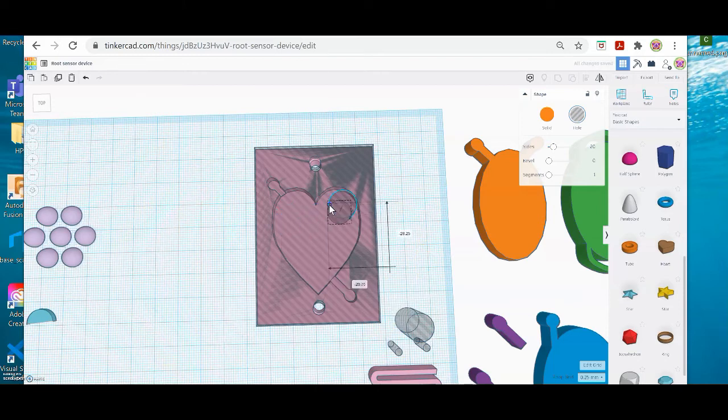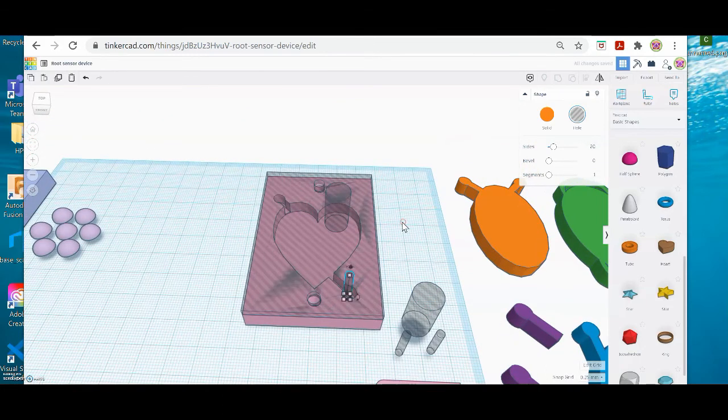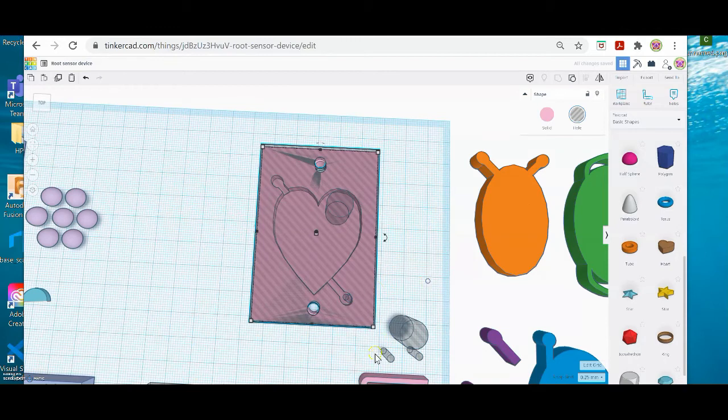And I'm just going to put mine kind of in the corner of the heart. And then I'm going to take, oops, it's copying the wrong thing. A duplicate of this smaller cylinder and try to align it where I want for that port. And again, you're going to want to shift into different views to make sure that you're aligning things pretty well. And then I just need one more port hole. And that one I'm going to stick in the top left.